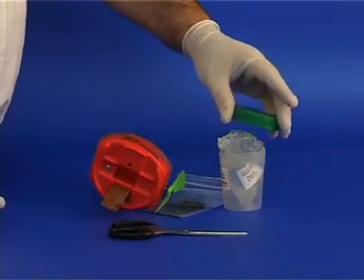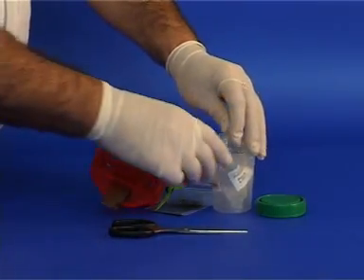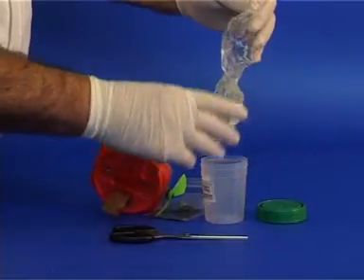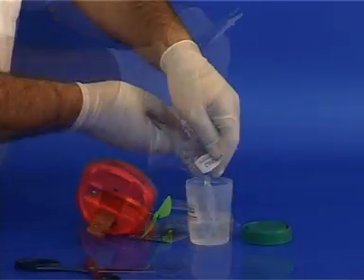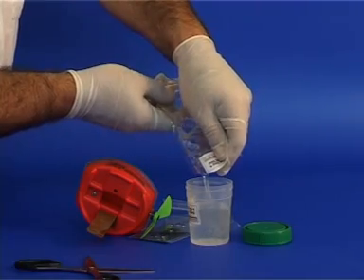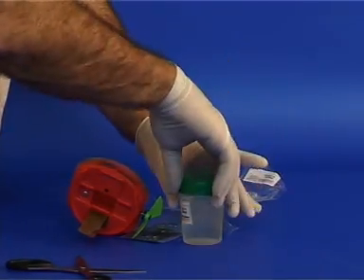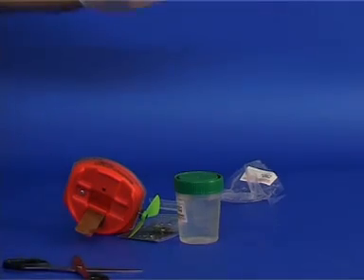In the container we have a bag with a dilute hydrochloric acid solution. Take out the bag and cut it open. Pour its contents into the plastic container and cover the container. This solution can be stored and reused many times.